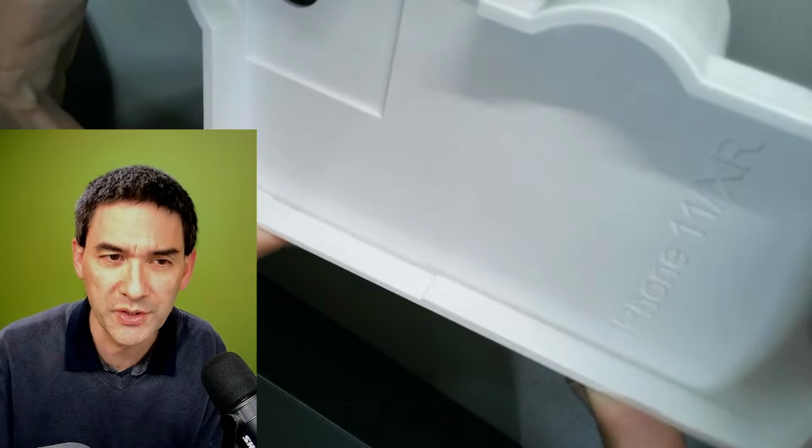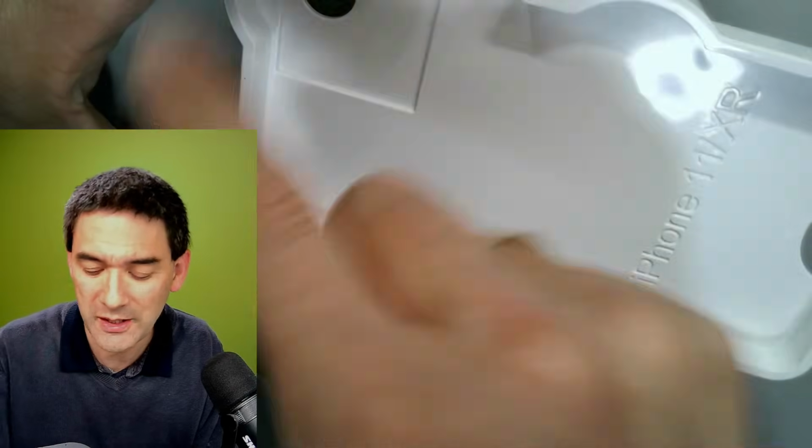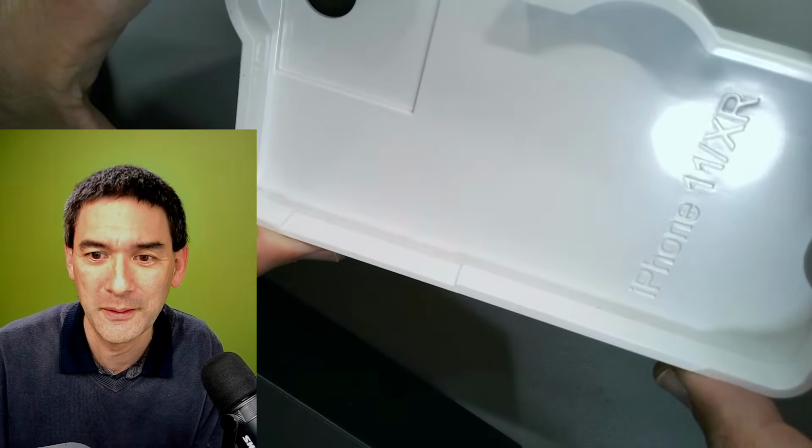I kind of like this concept because then you can use the iPhone a little bit like a, how do you say, like a display for the microscope. Yeah.